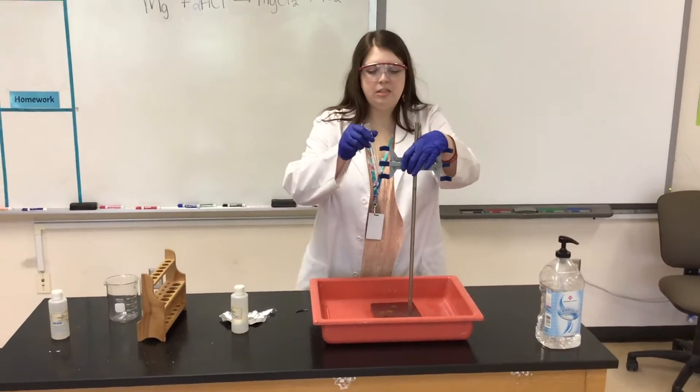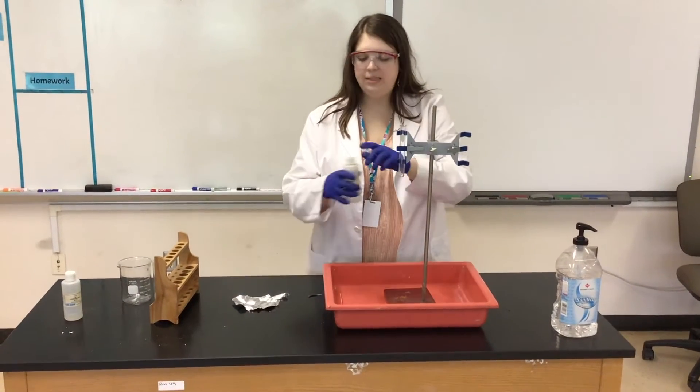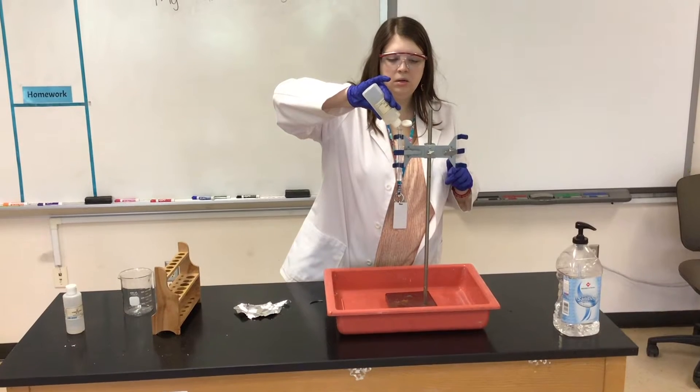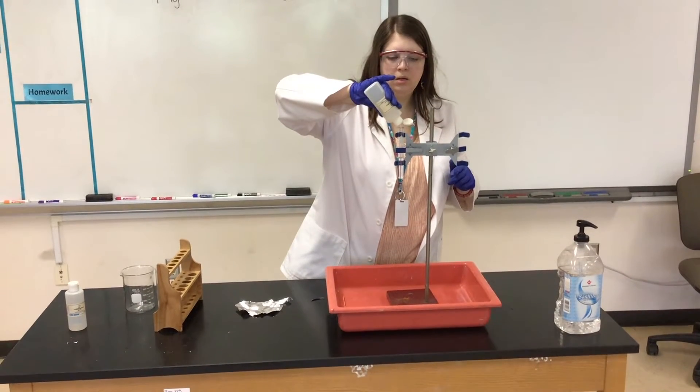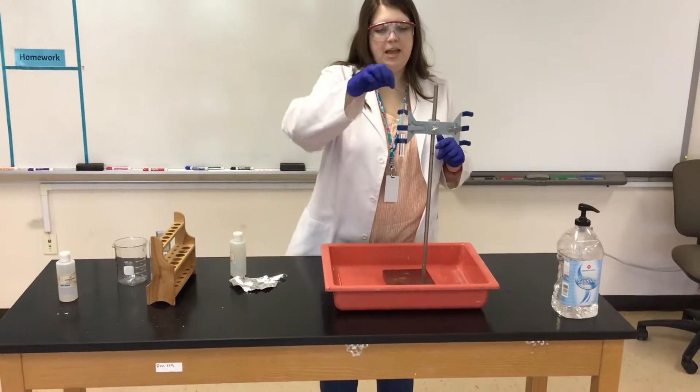I'm going to take a test tube and put some hydrochloric acid in this test tube. Then we're going to take some magnesium metal and drop it in.